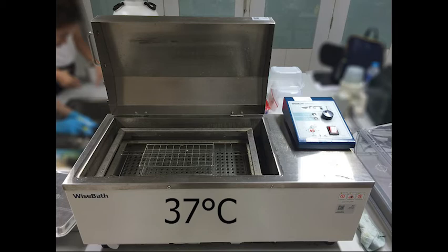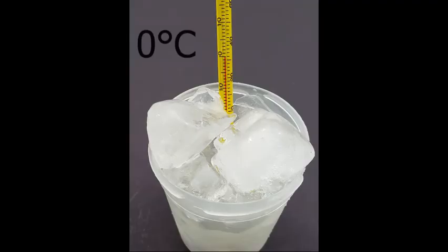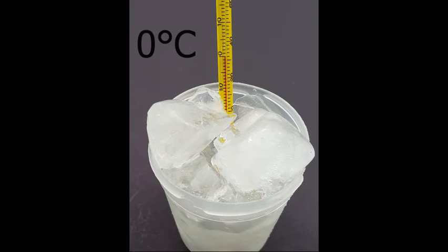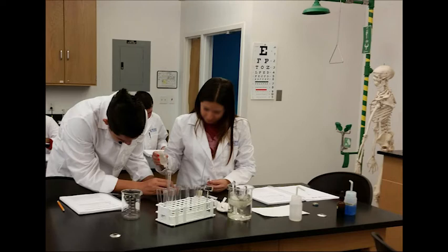Incubate all test tubes one through five at 37 degrees Celsius. Incubate test tube six at 0 degrees Celsius. After the incubation period, remove the test tubes from the water bath and shake them gently.